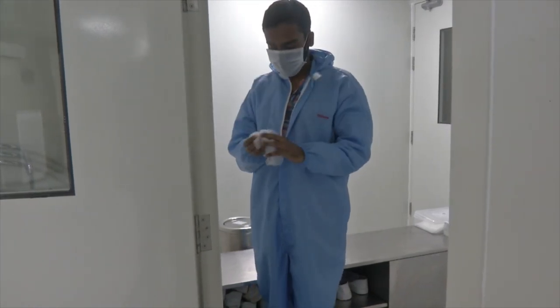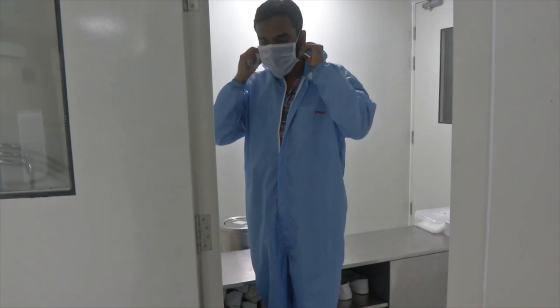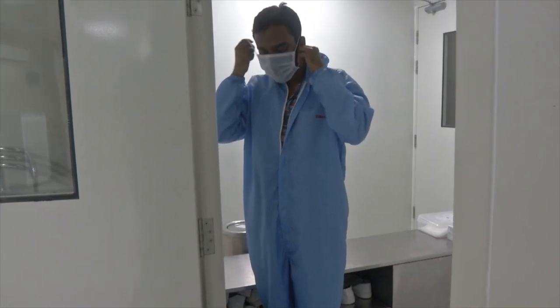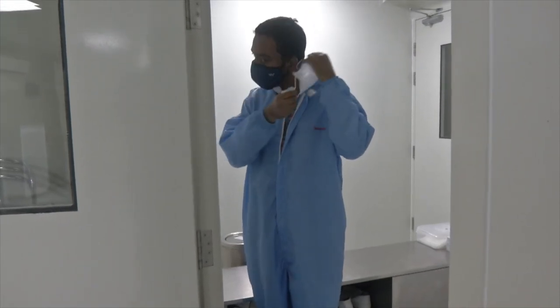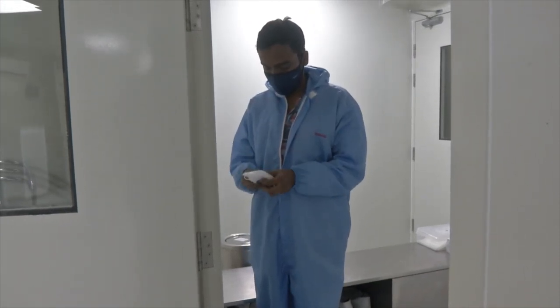Before removing the clean room gown, the next two steps are to remove the hair net and the mask.